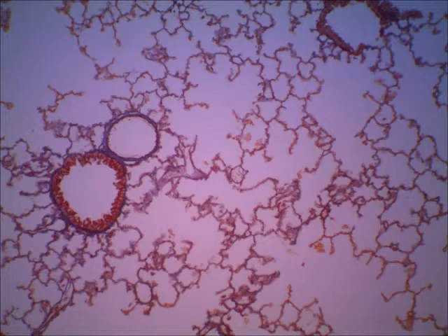All right, here is on low power. Rather than scanning, we're going up one power to the low power. And I see a couple of bronchioles right there with the arrows. And then with my blue line, oh, that didn't work. Excuse me. Arrows for the bronchioles. I'm sorry. I can't always get these e-board tools working just right.